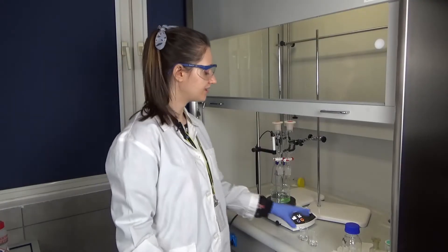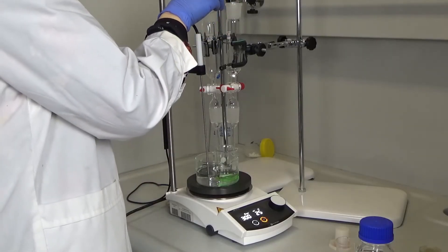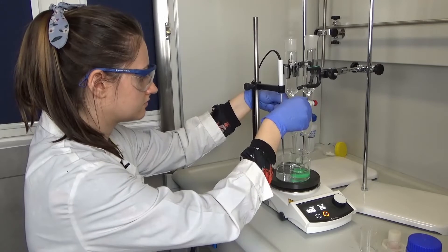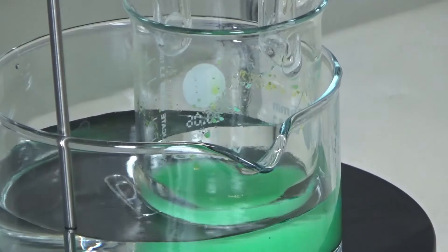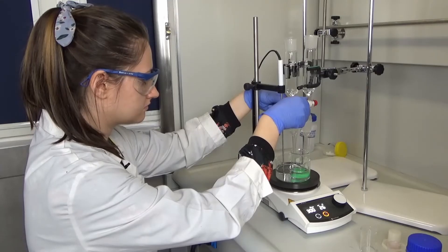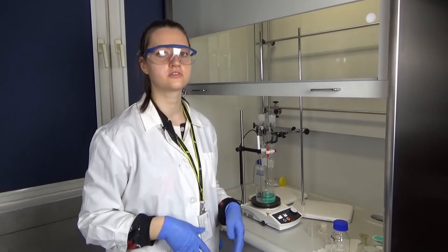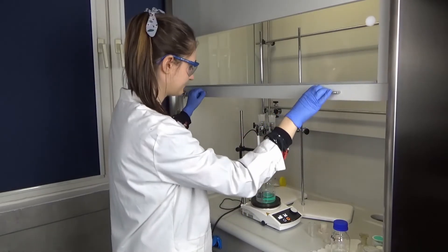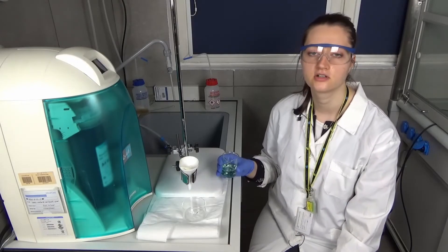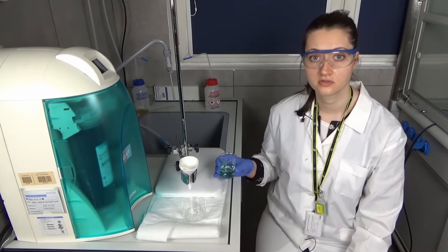Now I'm going to add simultaneously these two solutions. I could do it manually, but to ease this process, I'll use these two glass elements. We have to leave now our solution for about two hours. After two hours of mixing, I'm going to remove all of this undissolved part, so I'm going to perform a filtration.